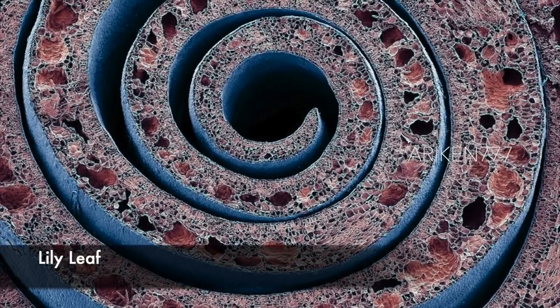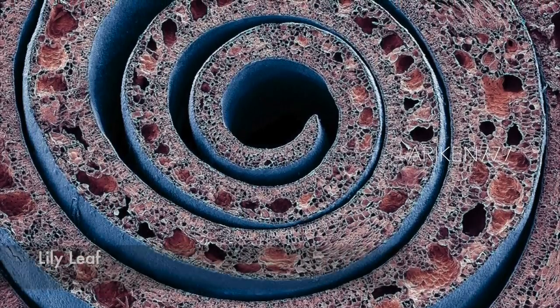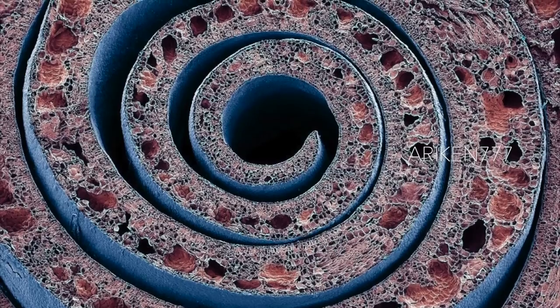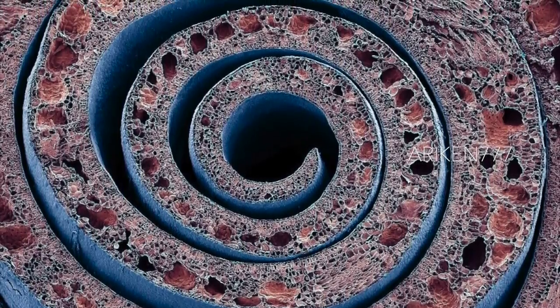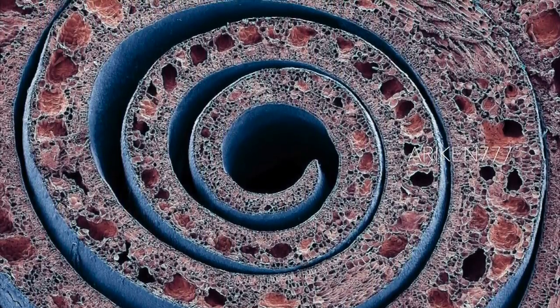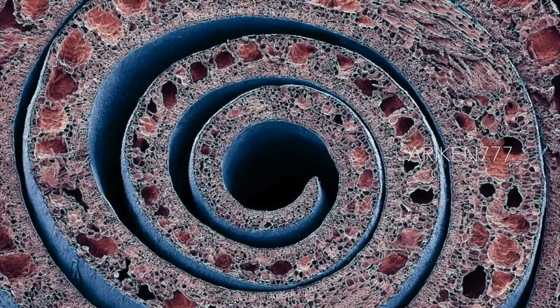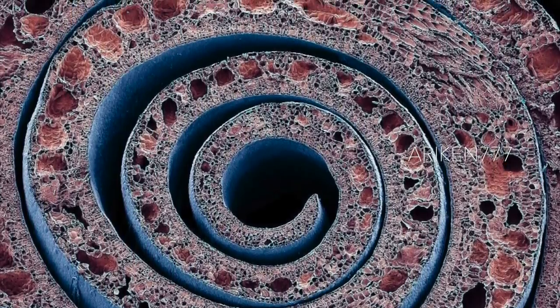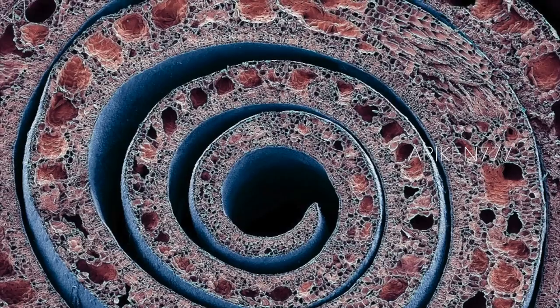A cross section of a coiled leaf from a water lily plant. This plant has floating leaves that uncoil to form a flat structure on the surface of the water. The plant cells can be seen as rectangular shapes inside the leaf. They contain chlorophyll, the green pigment used to convert sunlight into energy during photosynthesis.